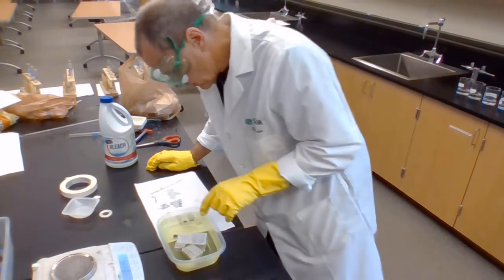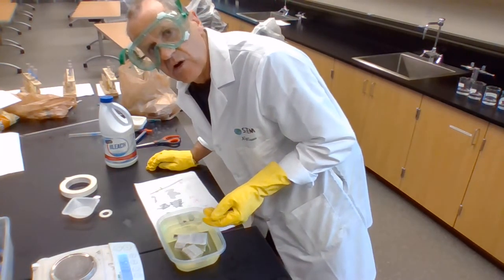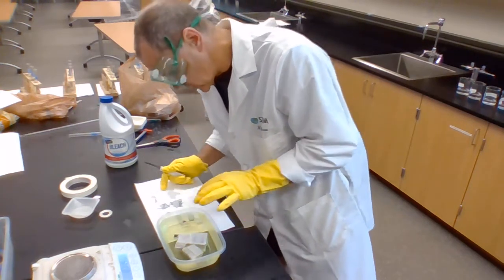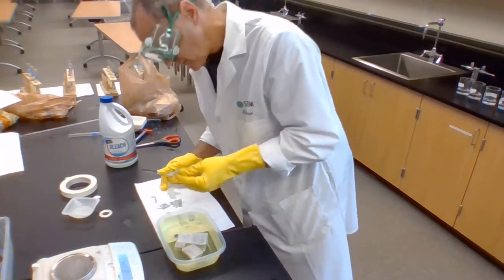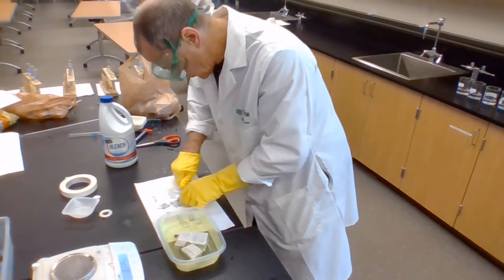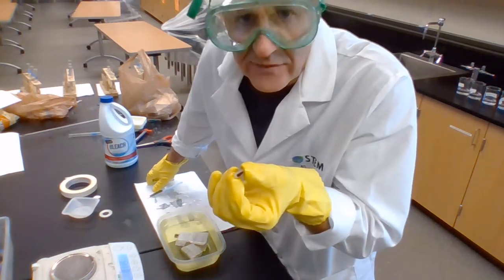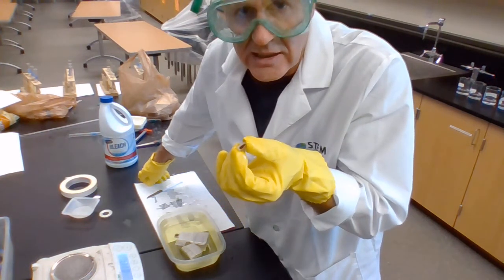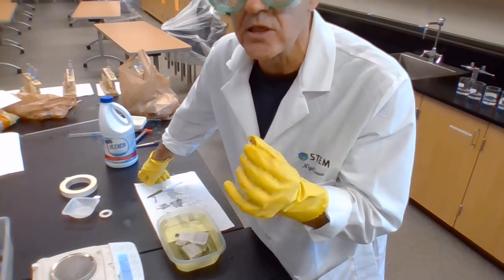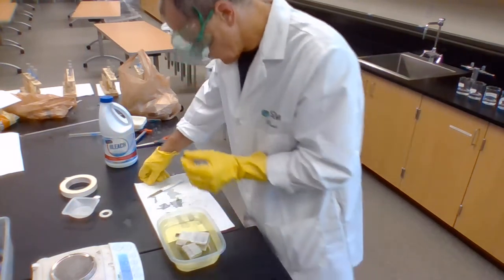Of course, most organisms don't want bleach, and so what we're doing is looking at the idea of oxygen diffusing from the membrane throughout the whole volume of the cell. Now, last time I cut the 1 centimeter cube up, and now we cut that open, and I think it's about half an hour again since I did the last video. You can see that there's a total of about 2 millimeters of diffusion going on.